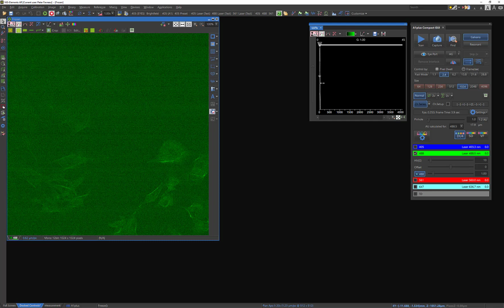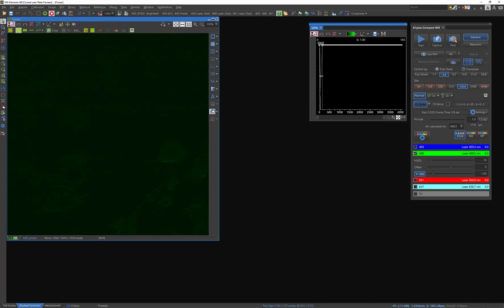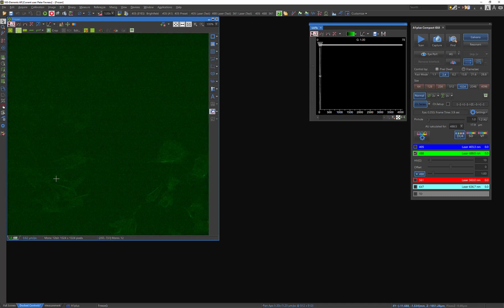And what I want to see is values, or this graph here, extend to roughly about half of this total value. And the reason for this is because this will give me a good contrast between very bright signal, which will be up here, and the background. I want to see a big difference between those two. And so that's what I'm going to aim for. Right now you can see it's very much mostly background. And of course you can see that in the image. Hopefully you'll see just a little bit of signal peeking through, but mostly it's background.